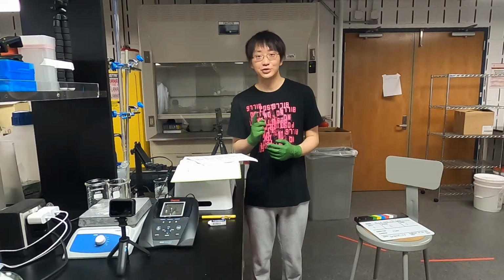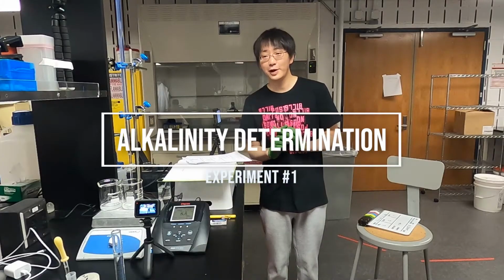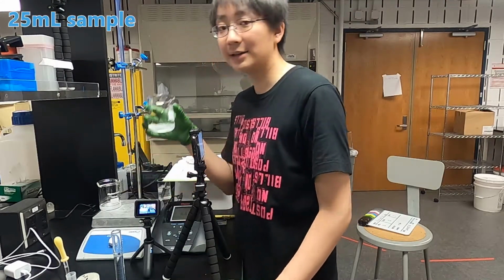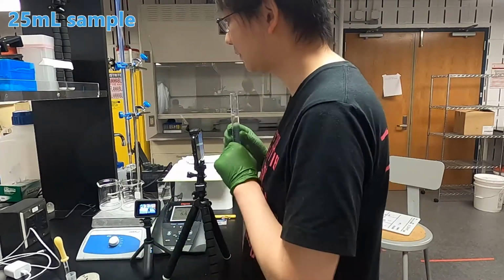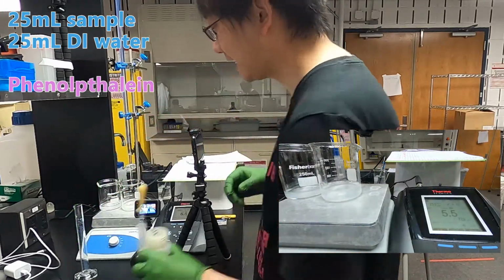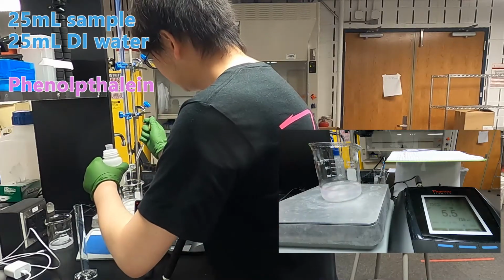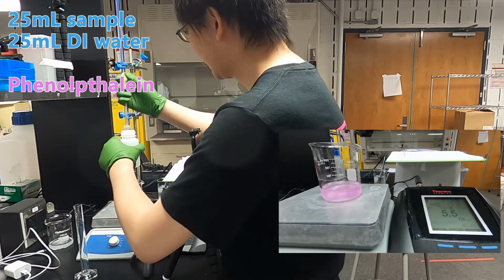And then let's do the experiment. So now let's do the alkalinity experiment. First, we have 25 ml of sample in the beaker, and then we add 25 milliliters of DI water into the solution. Then we add several drops of phenolphthalein into our sample. We can see that the solution becomes pink.